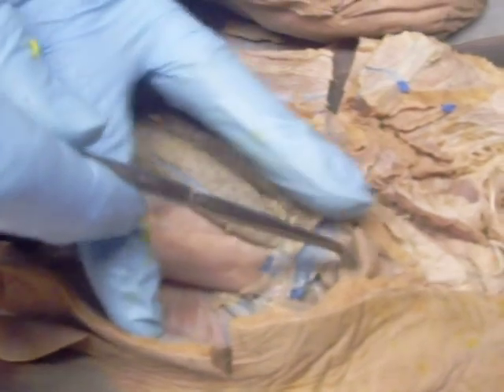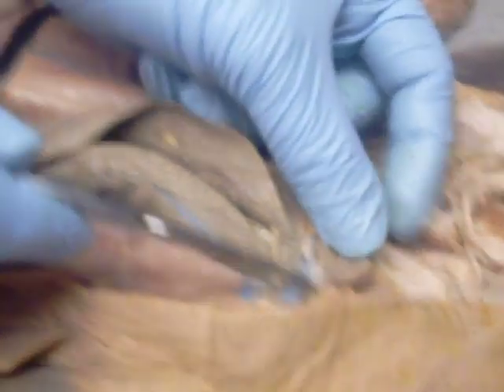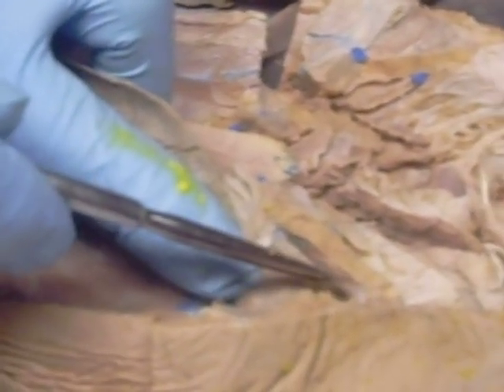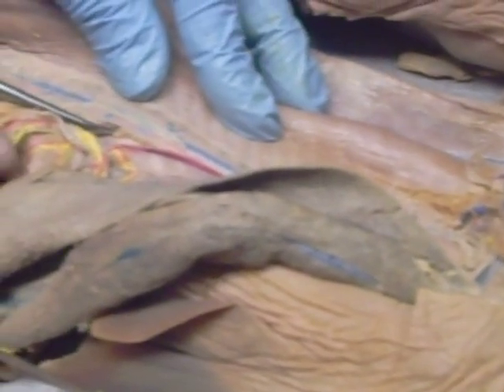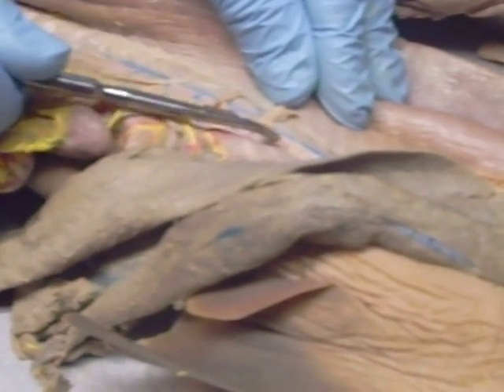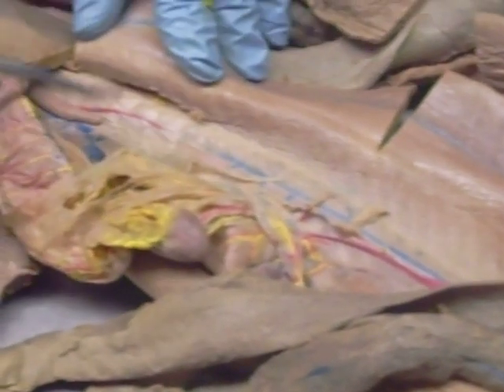If it comes out of the gills, it's the efferent. The heart will be asked too. So this is the ventricle — blood goes from sinus venosus into the atrium, into the ventricle, into the conus arteriosus — all those are pretty obvious — into the ventral aorta, then the afferent arteries into the gills, and then the efferent arteries are coming out here, and they all collect together to make the dorsal aorta. The dorsal aorta is not so very visible because it's still in the body wall — there it is, that red in the body wall. Branching off of it: the celiac, the gastrosplenic, and the posterior intestinal.